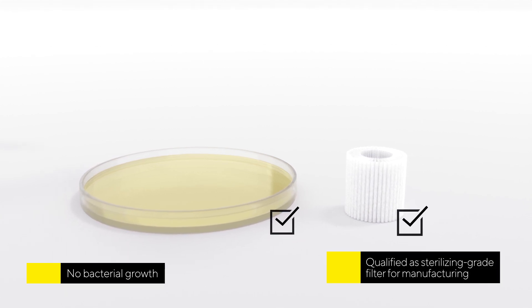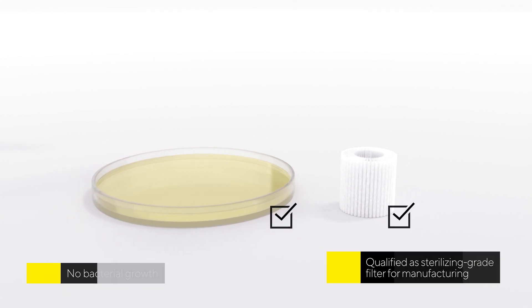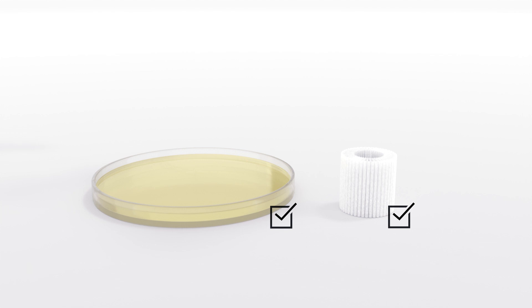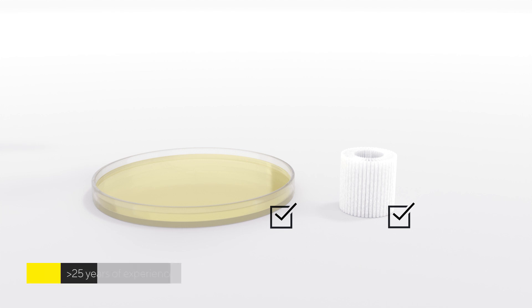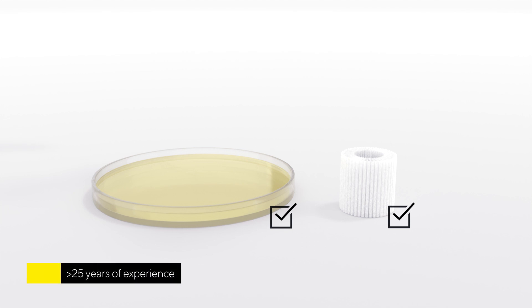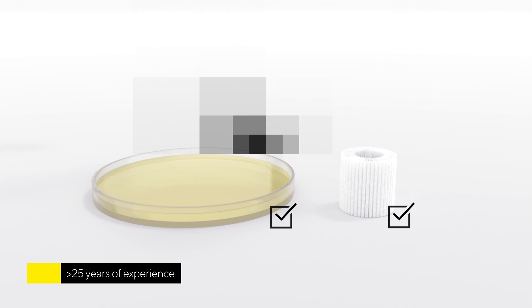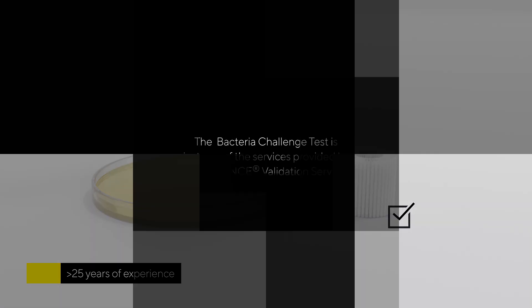Thanks to more than 25 years of experience, we are able to simulate all parameters and approaches and deal with any kind of product solutions. The bacteria challenge test is just one of the services provided by Confidence Validation Services.